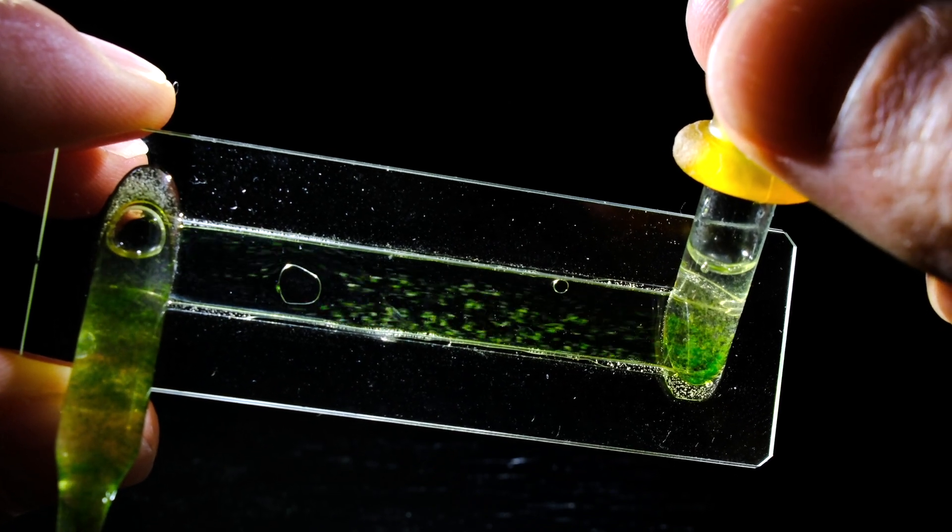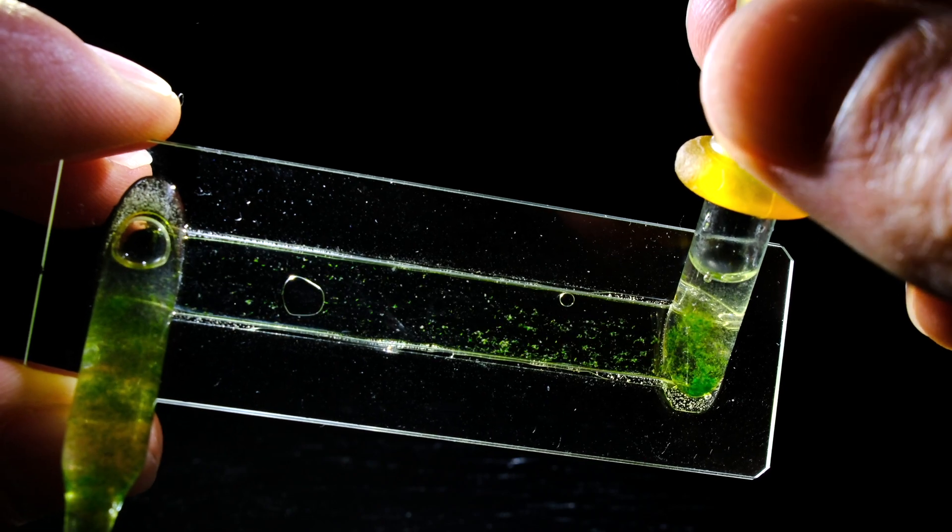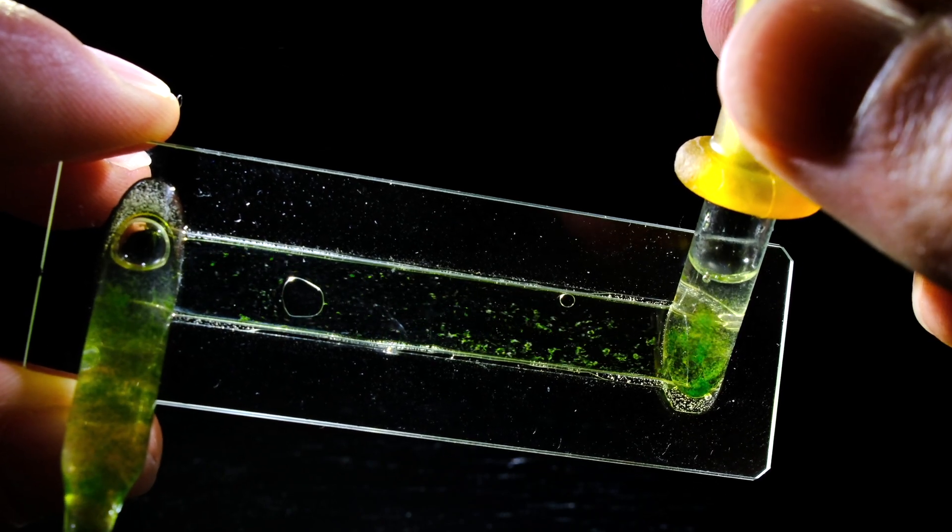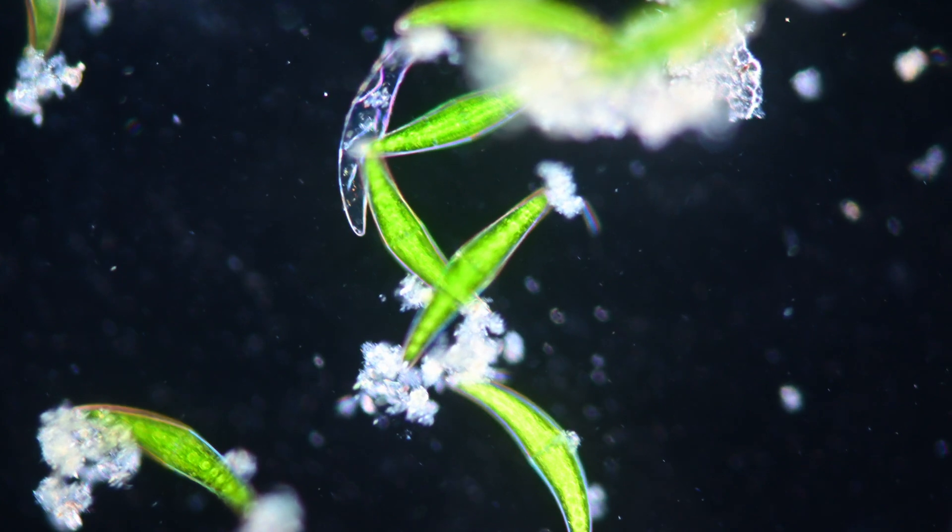Unfortunately, when using higher magnifications, the depth of field is not very good, exactly for this reason. But up to around 100 times magnification, the frankenpipette is super useful.